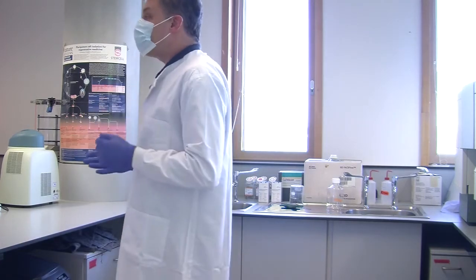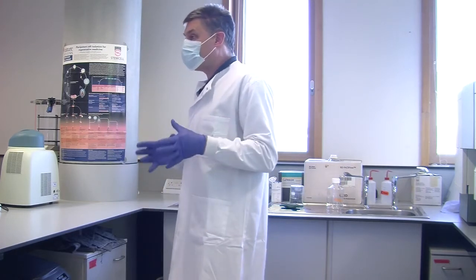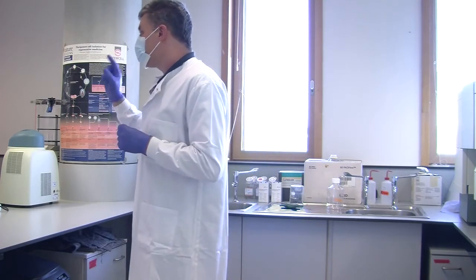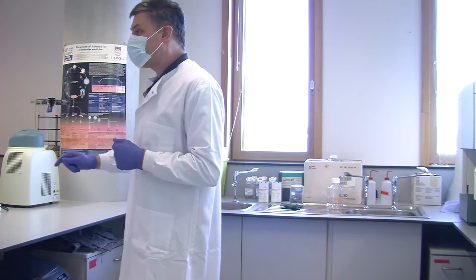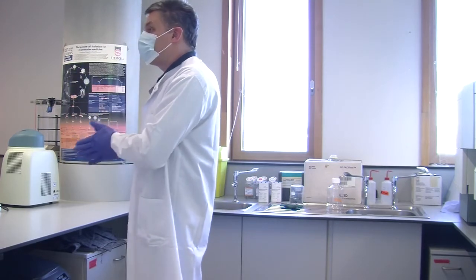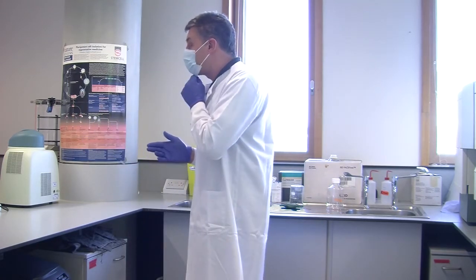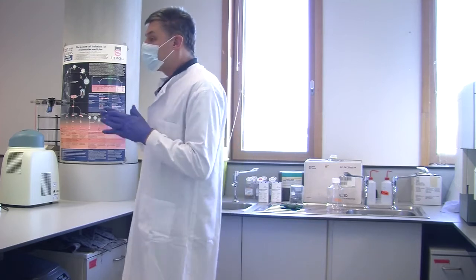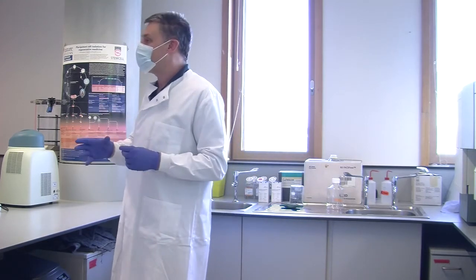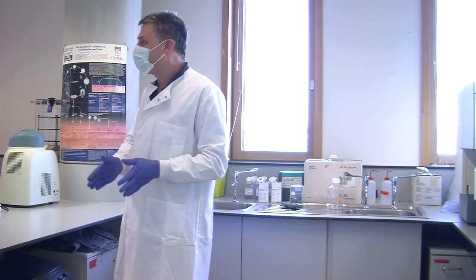They're not totally free from error, and in a way, the increased automation is a problem. Because if you get used to putting it on and clicking go, and then your data comes out, and then you click go, and your data comes out, you're not used to looking at the data and seeing if it's correct or not. And actually, diagnostics labs, hospital labs, are finding this problem more and more. Because all the companies that sell the instruments look at all this wonderful automation, look how easy it is. You don't need trained staff to run this, anyone can do it, until there's a problem.